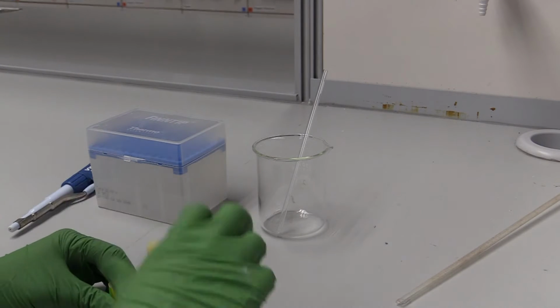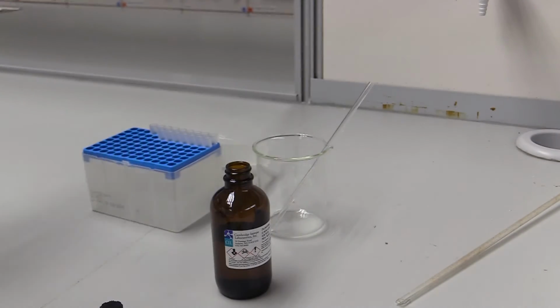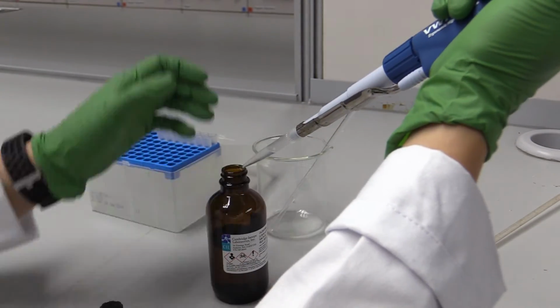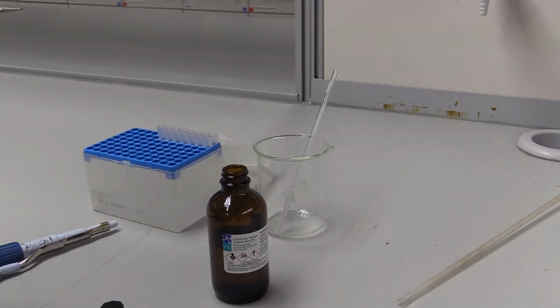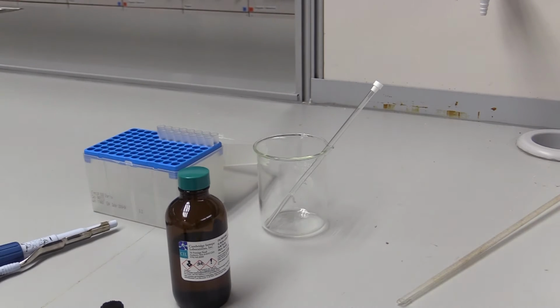For liquid samples, place one drop of your compound of interest in an NMR tube. Pipette 700 microliters of deuterated chloroform into the tube using a micropipetter. If you do not know how to use it, see the instructor. Put a cap on the tube and invert the sample several times to mix. Bring the tube down to the NMR.